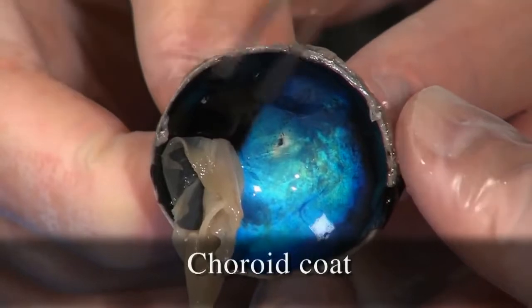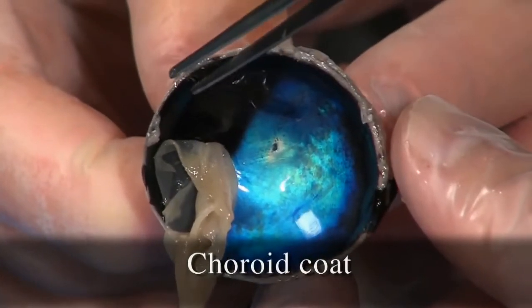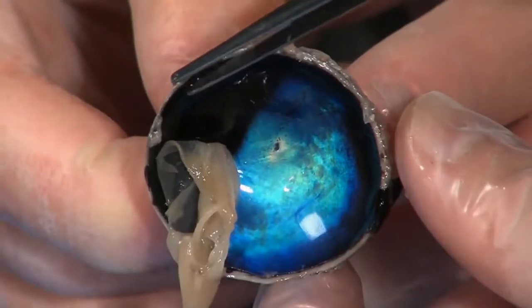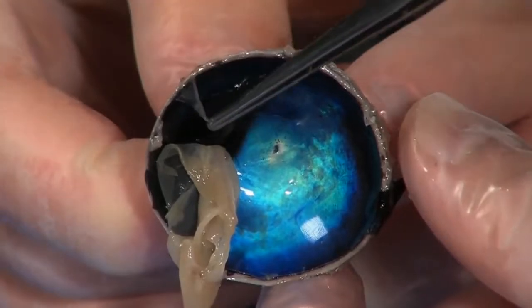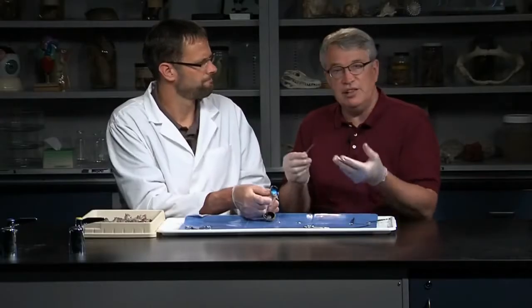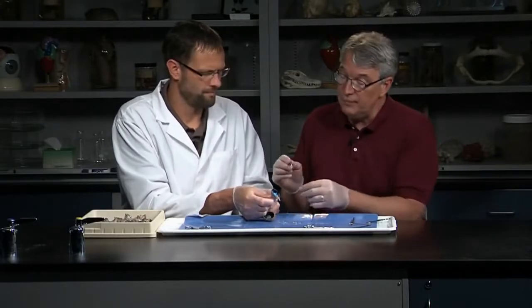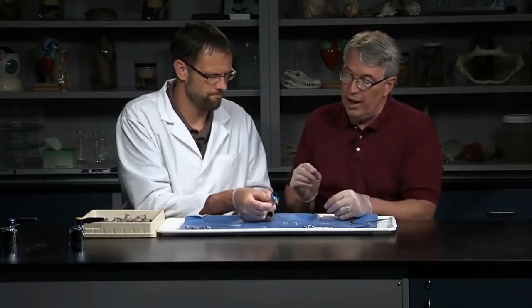You can see that the choroid layer is only loosely attached to the sclera. The choroid is richly supplied with blood vessels and provides nutrients to other parts of the eye. It's also very dark, which prevents light from scattering and getting reflected around.